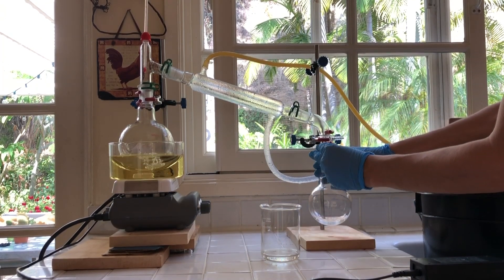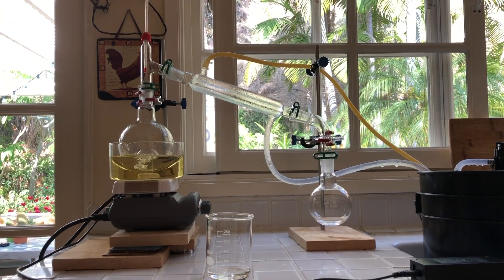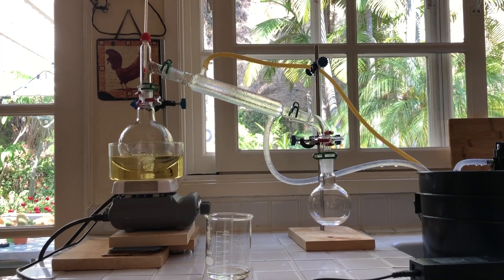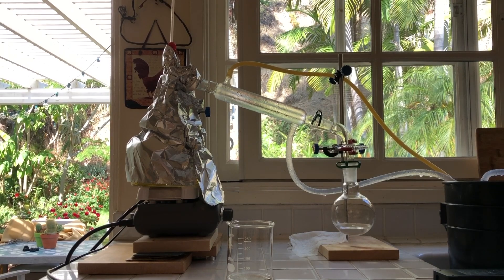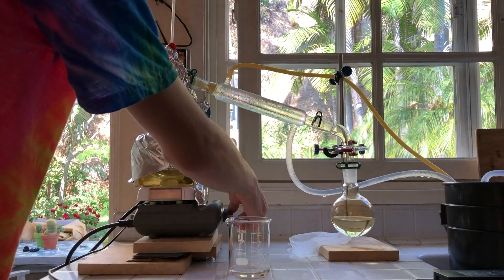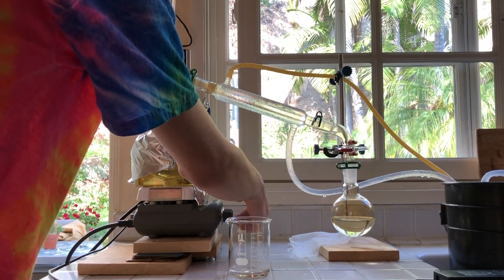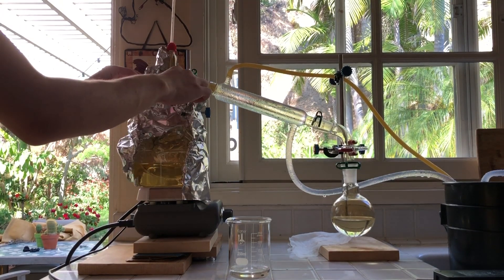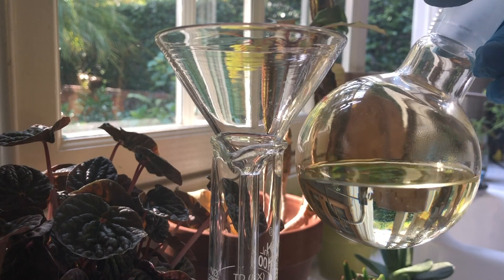This distillation took a very long time. My tiny Corning PC220 couldn't effectively heat the oil bath and the solution, so I ran to the grocery store to buy more aluminum foil while somebody else watched the distillation. After insulating, the distillation picked up speed. Finally, after nearly two hours, the distillation was complete. Unfortunately, due to the length of the distillation, the initially clear nitric acid began decomposing to nitrogen dioxide before the distillation was done, so I was left with a yellow liquid rather than a clear one.